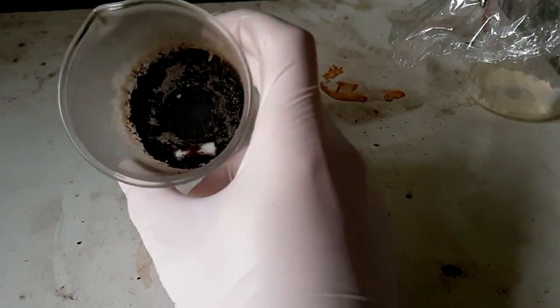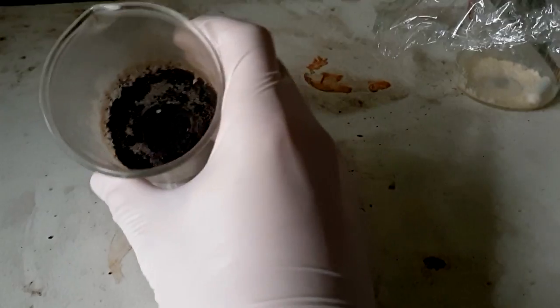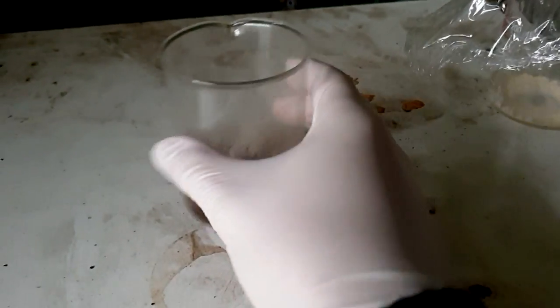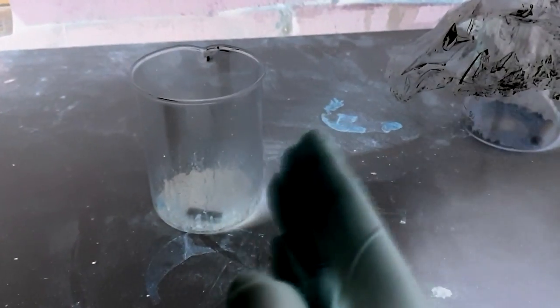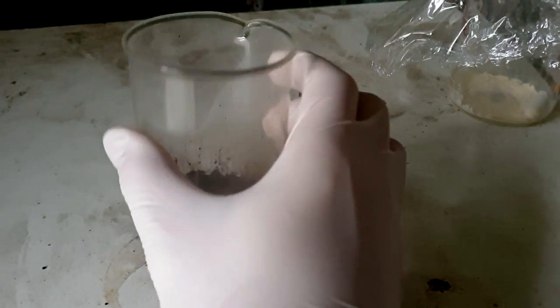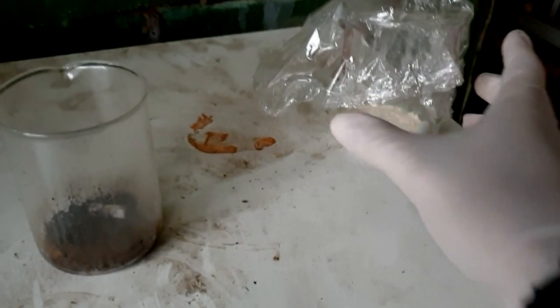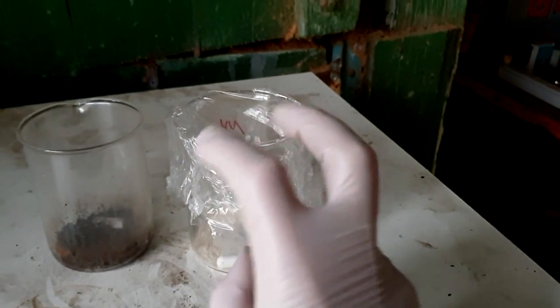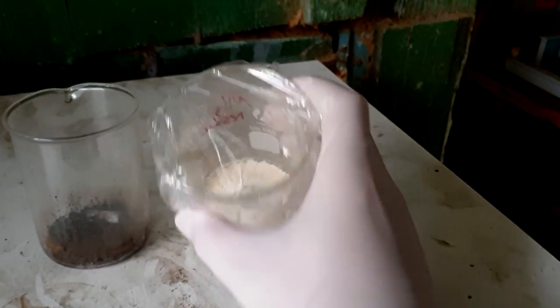All right, here's the end result of the ammonia and ozone solution that I boiled down. Get this black shit. Is it tar? I mean, I nearly go so far as to say it's tar. There's always more tar. And, I wasn't actually very surprised by this, because this is the result of the 200ml that we boiled down of just the pure ammonia solution that I had in the bottle. And, what's this? What's all this residue?